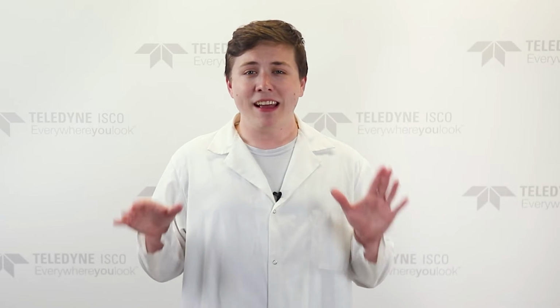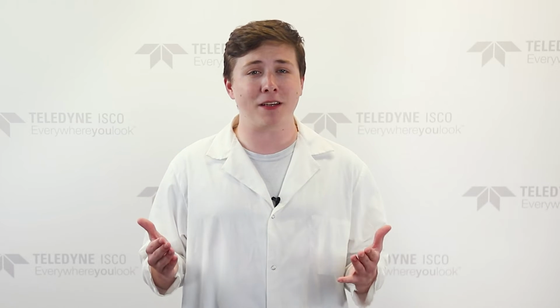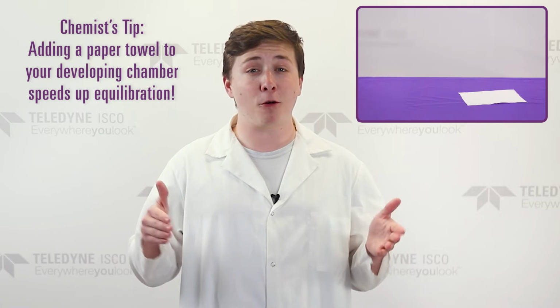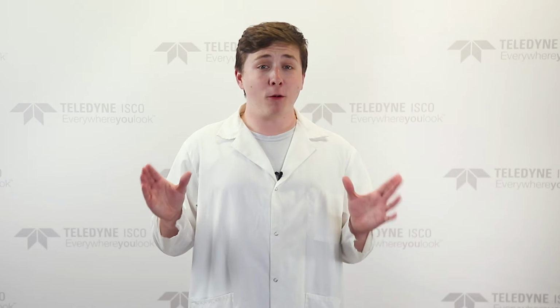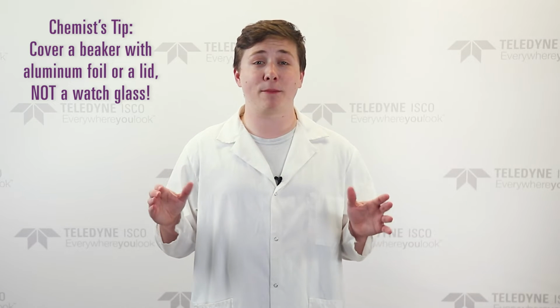One of the most common mistakes made when performing TLC is not allowing the solvent to equilibrate with the atmosphere inside the developing chamber. To correctly saturate the developing chamber, add a paper towel or filter paper to the chamber. Pouring your solvent over the paper helps facilitate equilibration. If you are using a beaker, make sure to cover the top with aluminum foil, as a typical watch glass allows some vapor to escape.